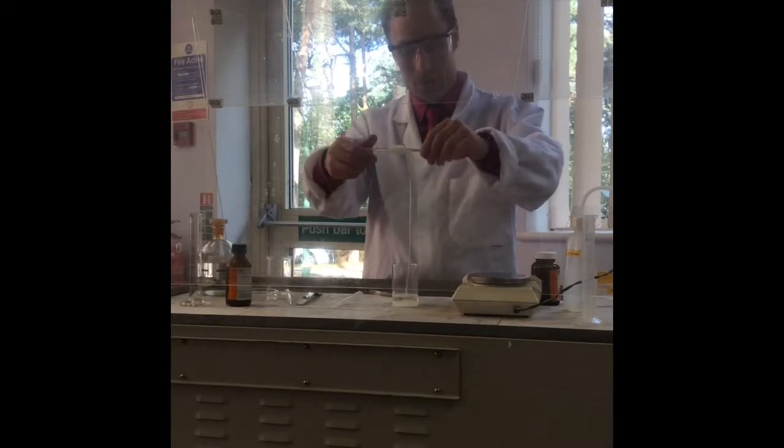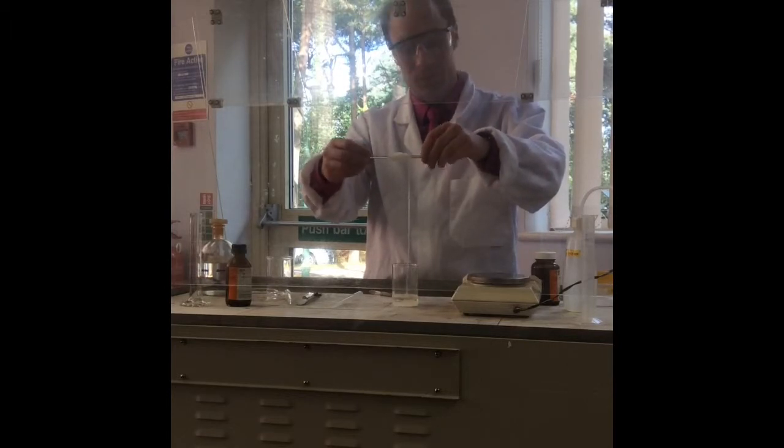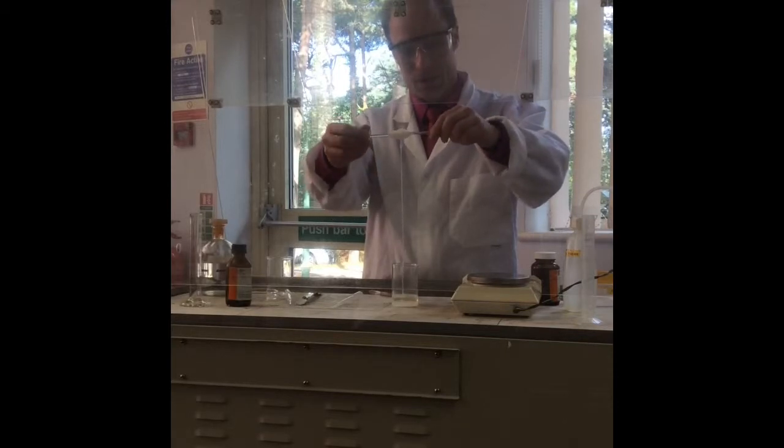How much is there going to be in the middle? It looks like a cocoon. Oh, I could go on for ages, because there's not actually that much in the middle. Will it unravel again? Sorry? Will it unravel again? No. Now I've got a lump going on. Oh, gross.